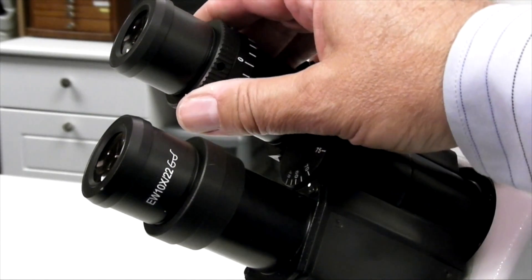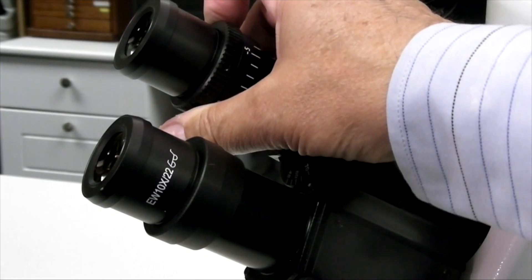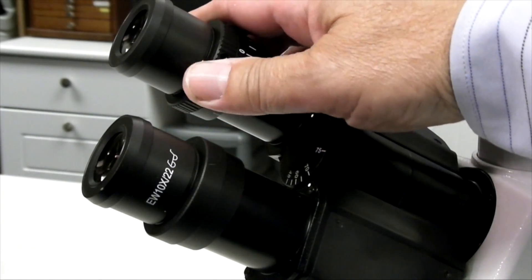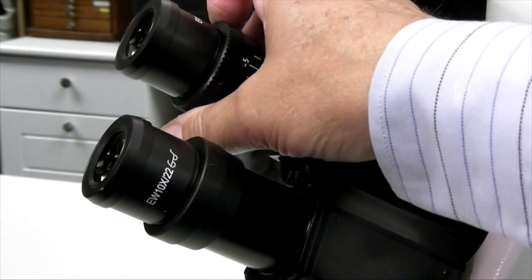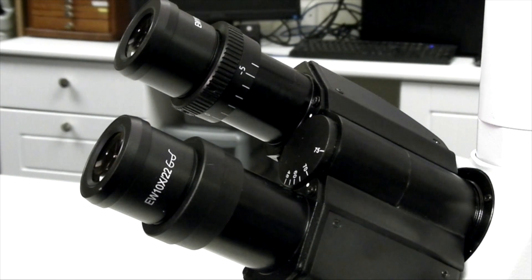The microscope is now also compensating for any focus differences. The eyepieces in this microscope can be used without removing glasses, which is shown by the small spectacles logo.